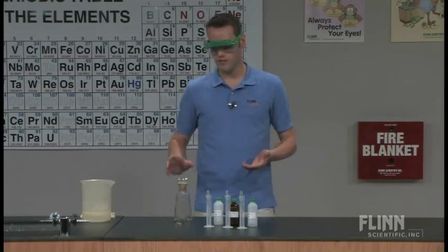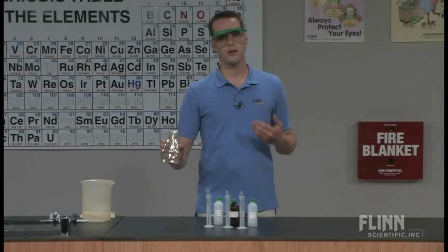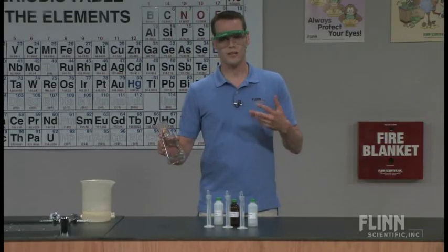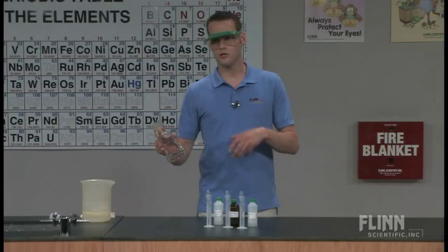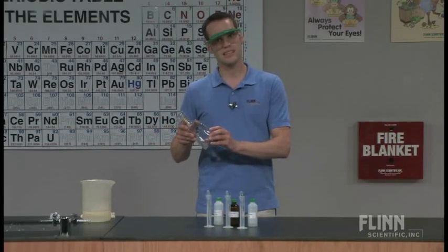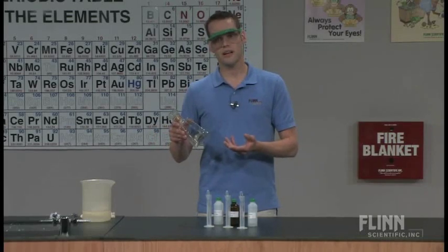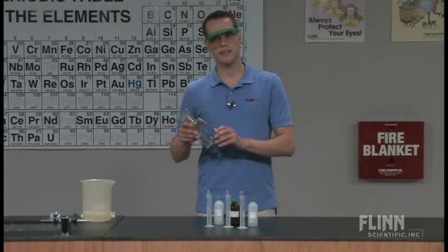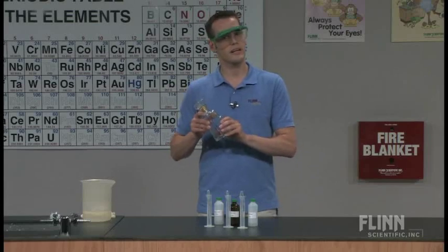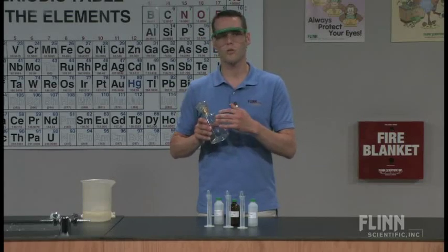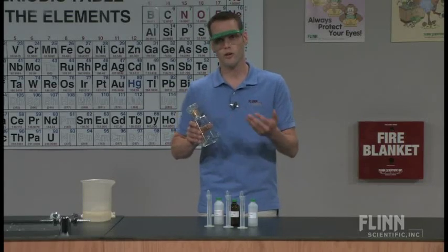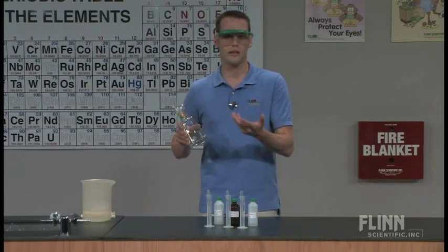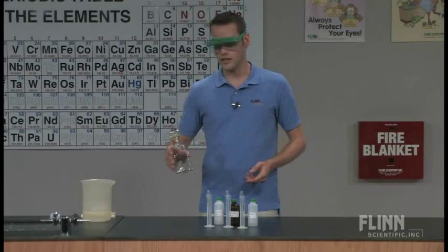I've already measured out 25 milliliters, I have a glass bottle here. When students bring in their own glass bottles you probably want to rinse them with a dilute nitric acid solution to dissolve out anything that's on the inside. Rinse with plenty of deionized water and then I usually do a final acetone rinse to make sure there's no oils or grease on the inside and they usually get a pretty good mirror. It does need to be dry before they start.